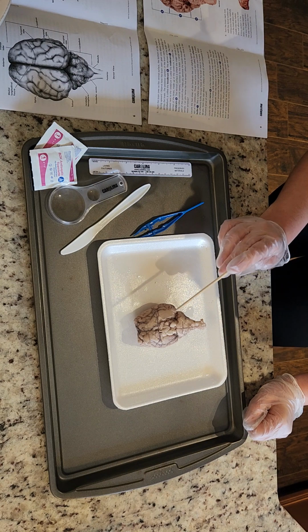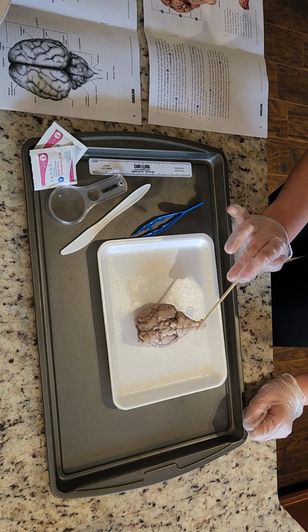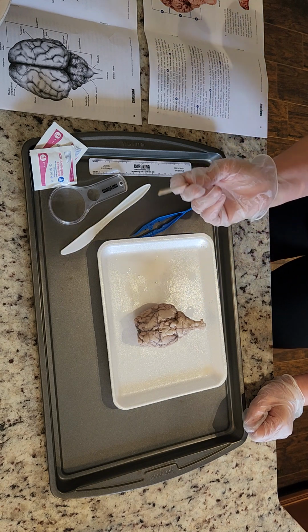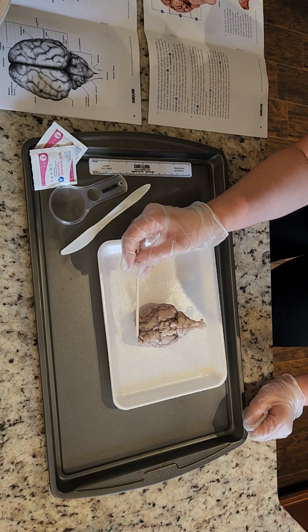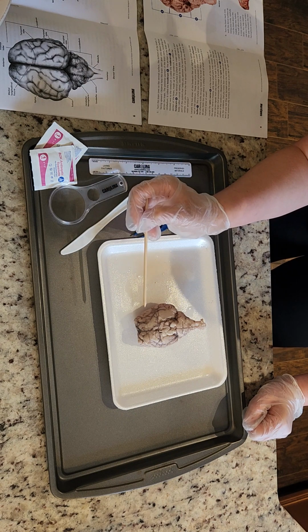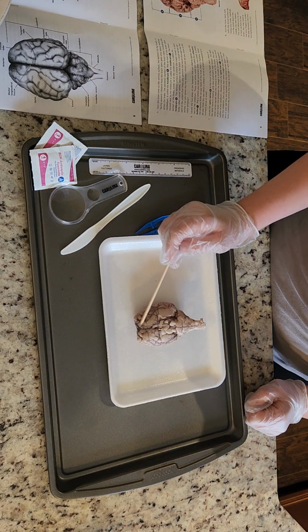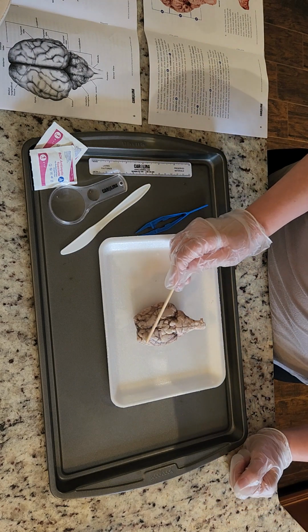which, you know, we talked about, we perceive the world through our five senses, this part of the brain. And then up here, we have the olfactory bulbs that help with smell. As we discussed in the lecture, this part is bigger on the sheep, meaning they probably have a better sense of the world around them through smell than humans.